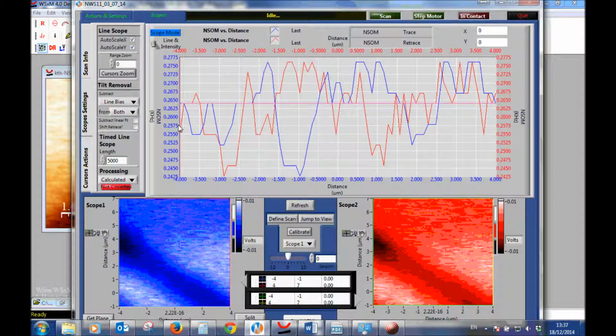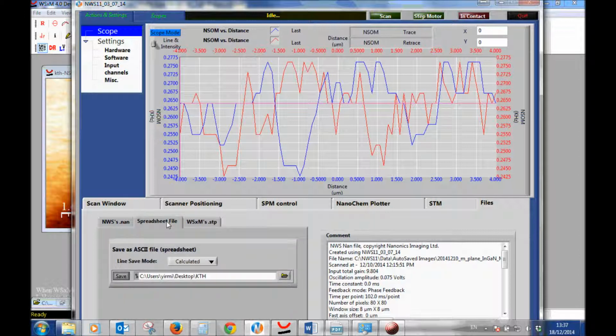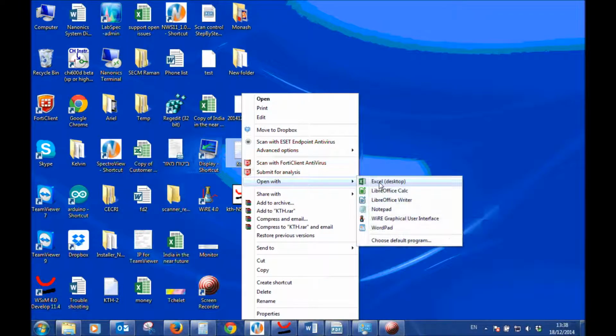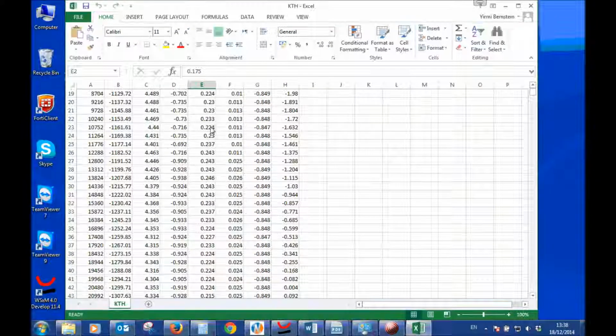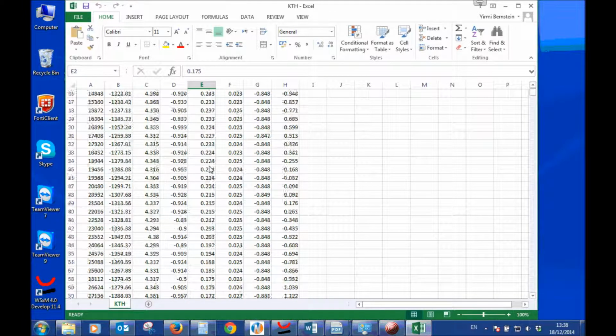So first we have to make sure that it's converted. So we press here, then we save it as a spreadsheet file. We choose a certain file name, we save it, and now we'll open it. So let's open it as an Excel sheet. And here we see that all the NSOM values are positive. None are negative.